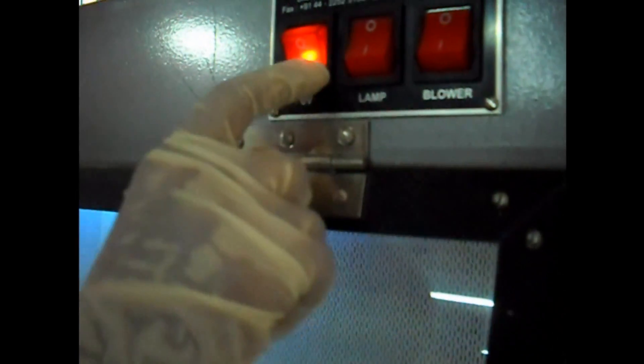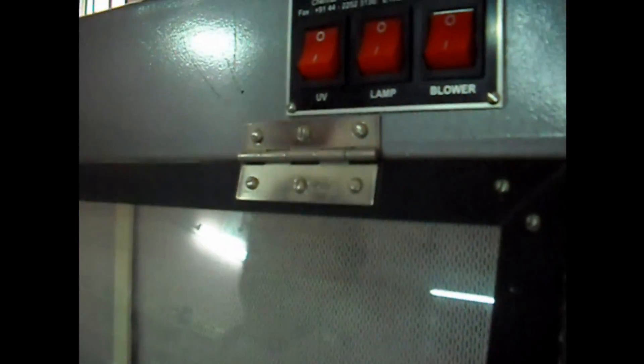Close the laminar airflow chamber. Switch off the light and blower and switch on the UV. After 10 minutes, switch it off. Take care.